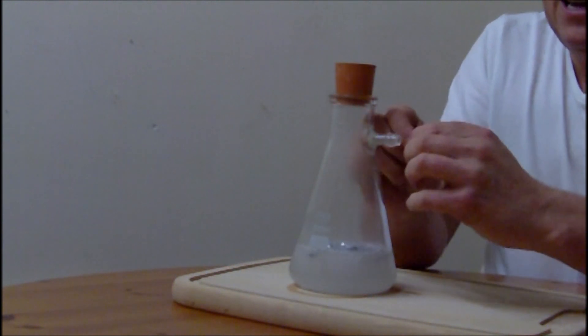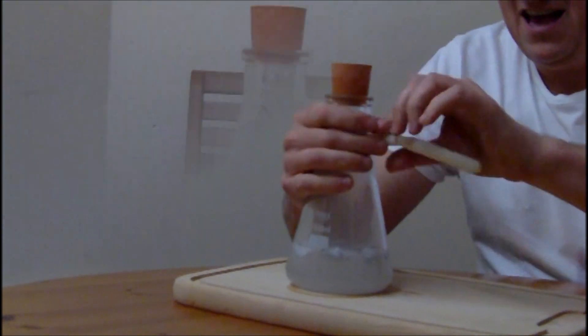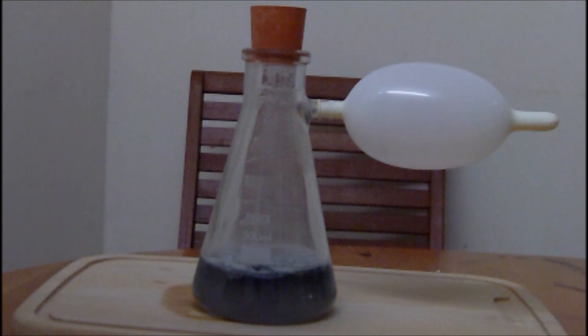So now we're going to add my Graf Zeppelin. You can see the aluminum is reacting really well with the sodium hydroxide. It's producing the gas and the balloon very slowly it's filling up. Obviously the Germans used a slightly bigger device for producing their hydrogen.